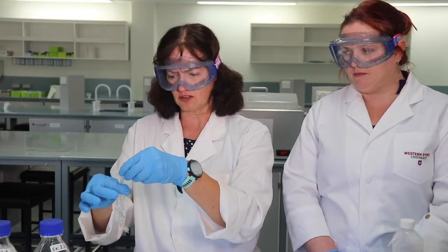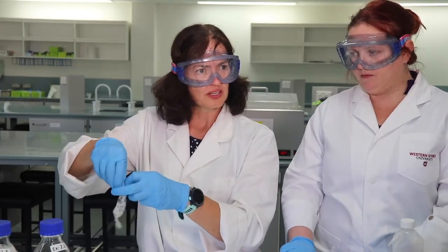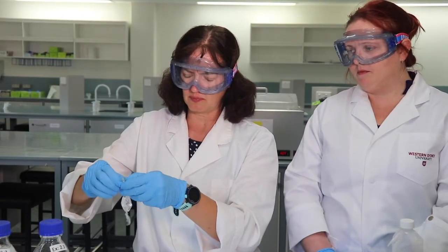So let's leave a bit of space, and we can either tie a second knot, and I think I might, because we have room to tie a knot, so I'll just do that.